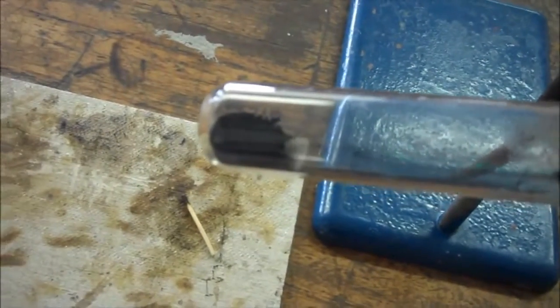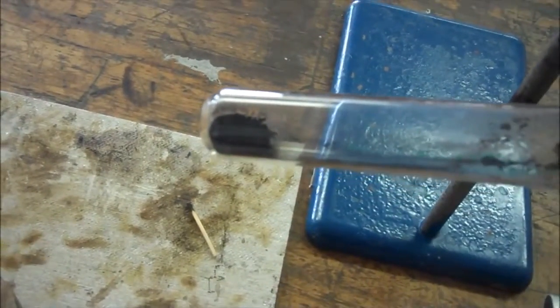The proof that carbon dioxide has given off is the lime water has gone cloudy. The proof that a reaction has occurred is the copper carbonate has gone black from a green colour to make copper oxide.